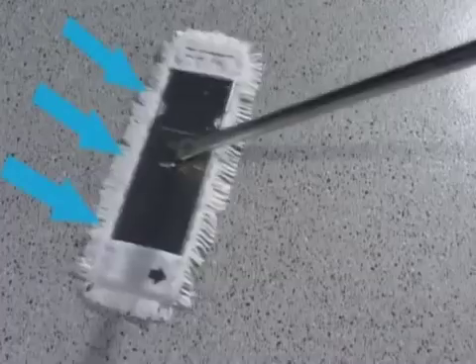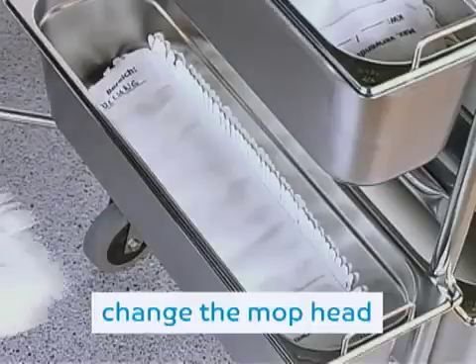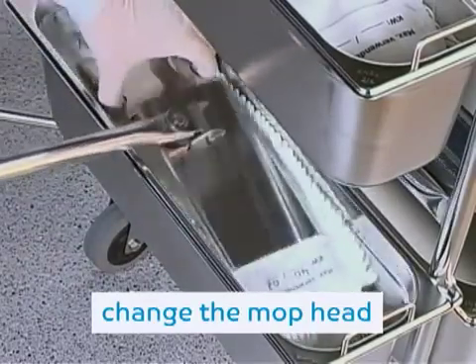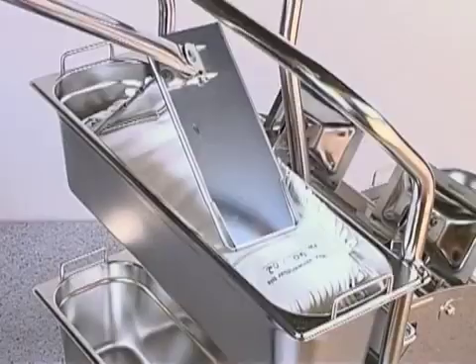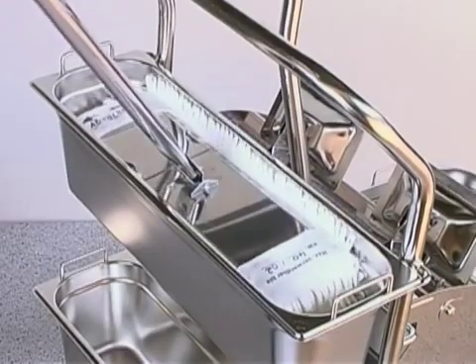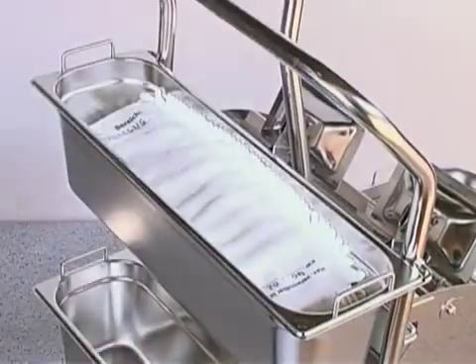You will also notice it by the mop becoming stiff. Of utmost importance, the used mop must under no circumstances be soaked again. The in-use solution would be contaminated. The used mop is laid in the lower container and removed from the fastener, without touching it with the hands. The new mop head is taken up from the upper bucket using the mop handle. Now you are ready for the next wipe cycle.